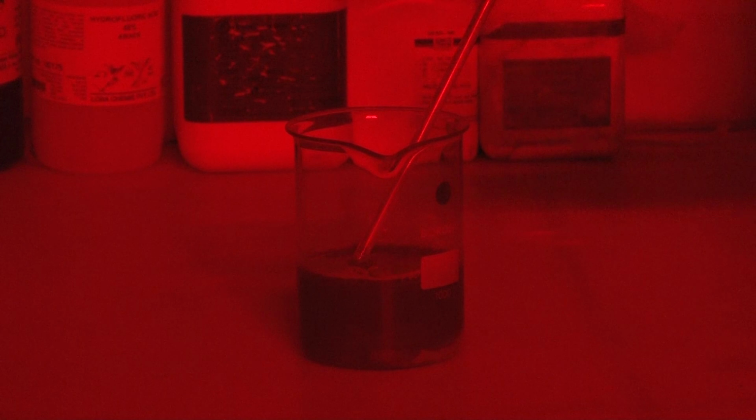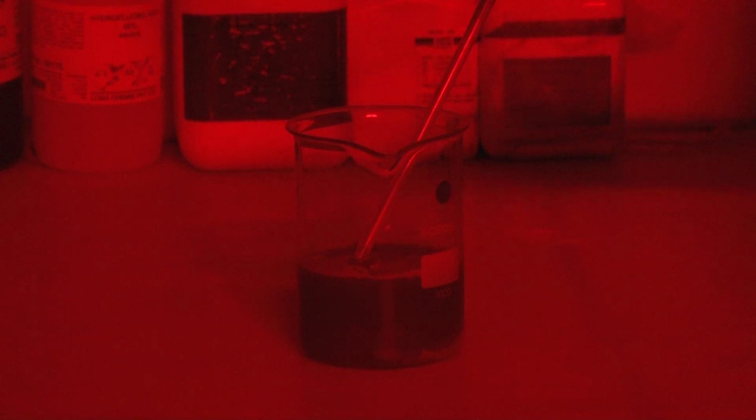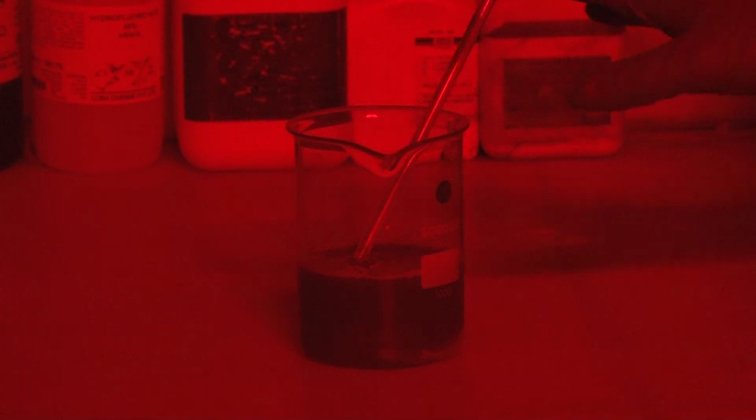As soon as the HCl reacts with the carbonate, it gives off CO2. That CO2 comes out from the sample in the form of effervescence. For normal samples, you have to keep your sample for at least 6 to 7 hours. It depends on the carbonate concentration in your sample. If your carbonate concentration is less, you have to watch for the effervescence from the sample.